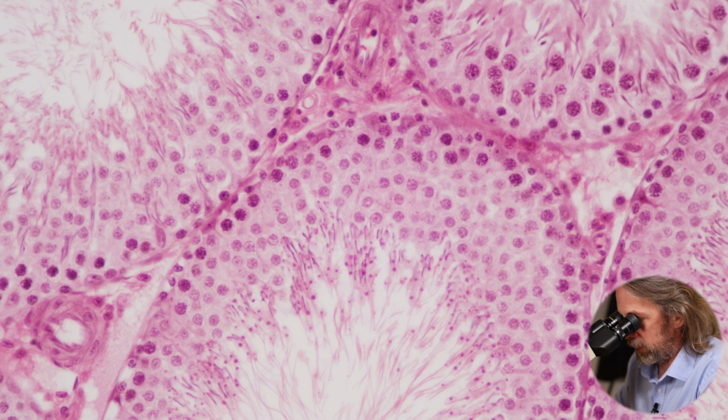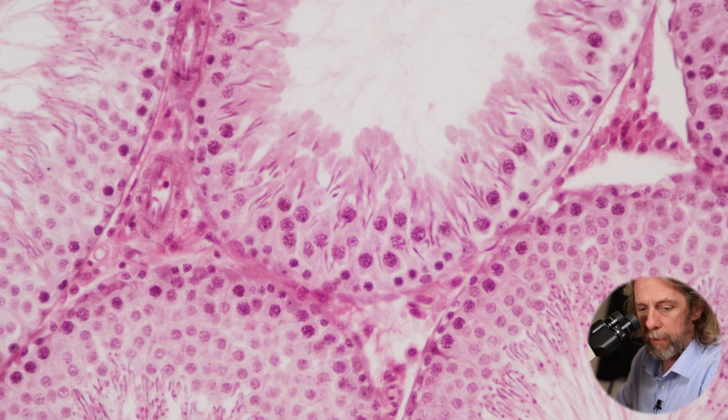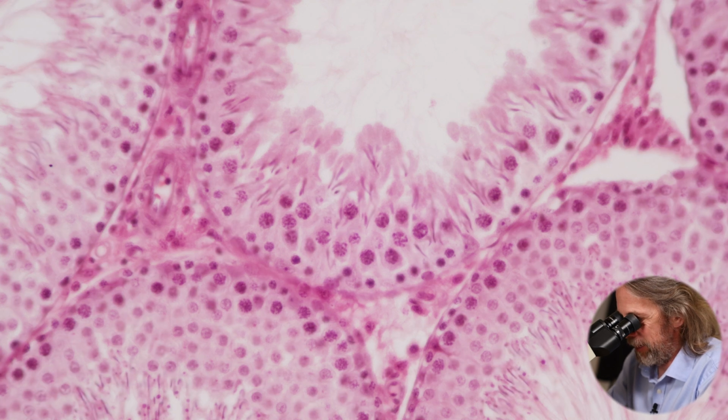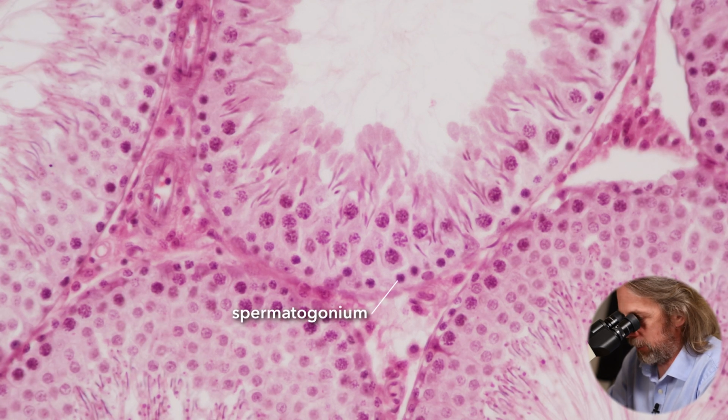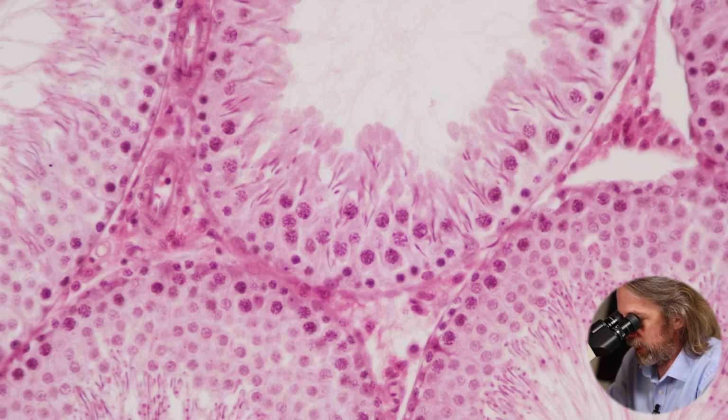In fact, I think the other one's a better example, if I slide up. Sorry to my future self in editing. We can see the spermatogonia around the outside, and then we can see large darkly staining nuclei. Those are the primary and secondary spermatocytes, so they're going through meiosis there. And as we get close to the lumen, we can see that the cell shape changes quite markedly to become spermatids. And then as we get right up close to the lumen, those spermatids have become spermatozoa.